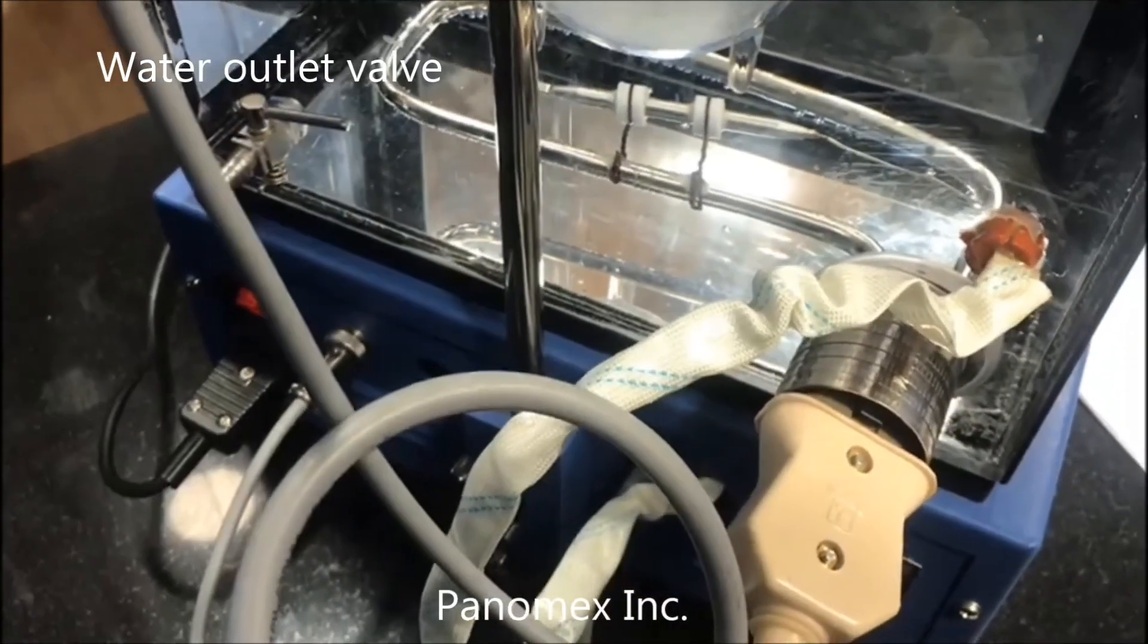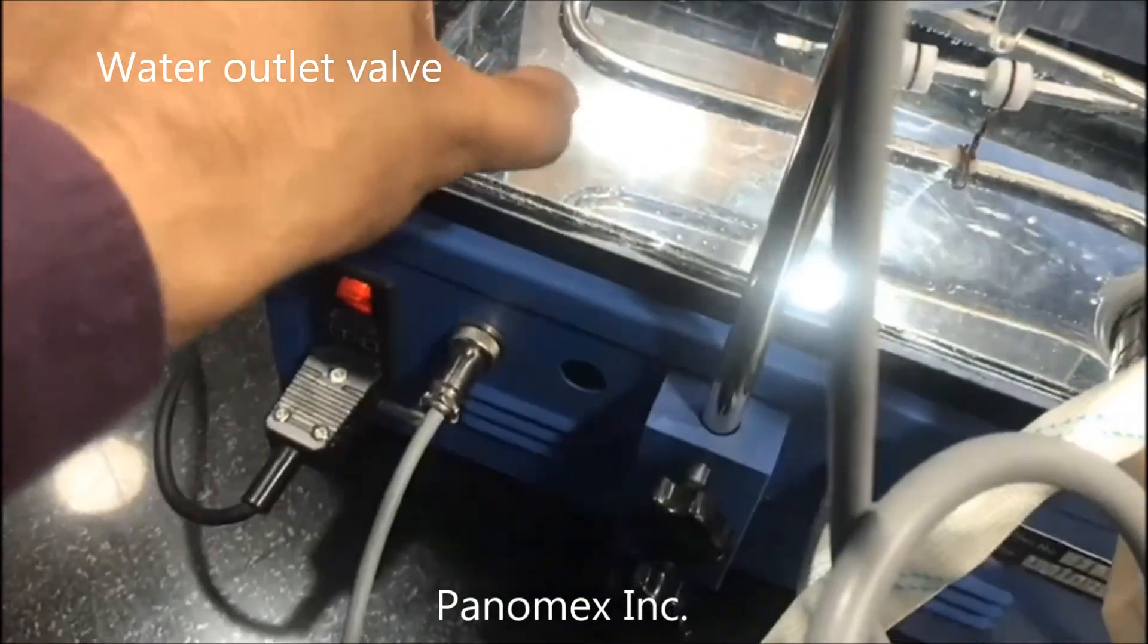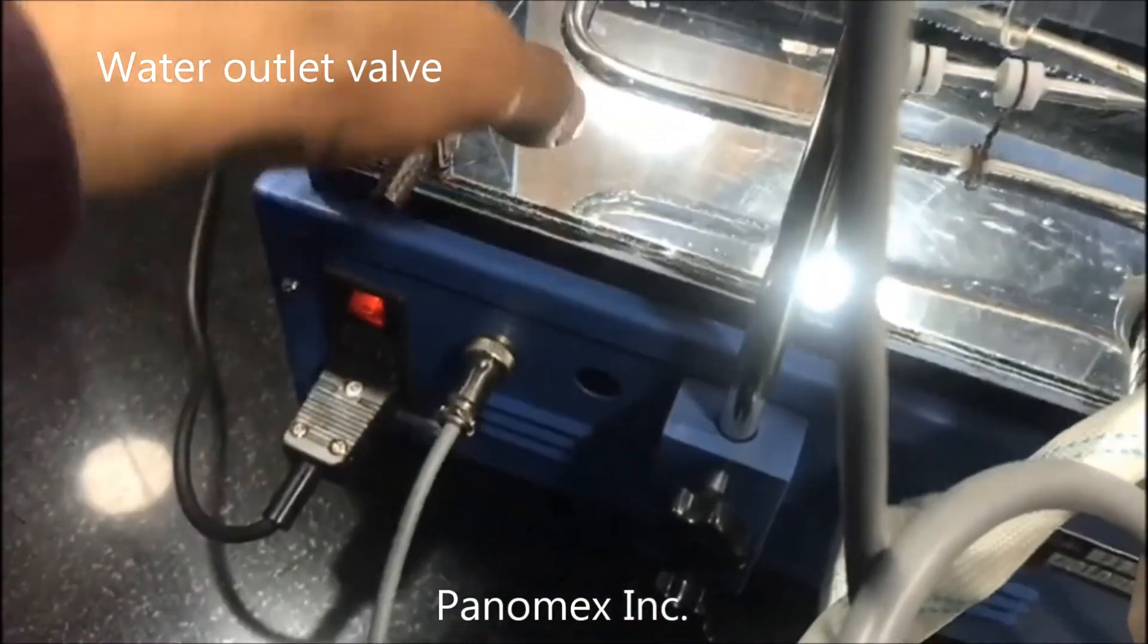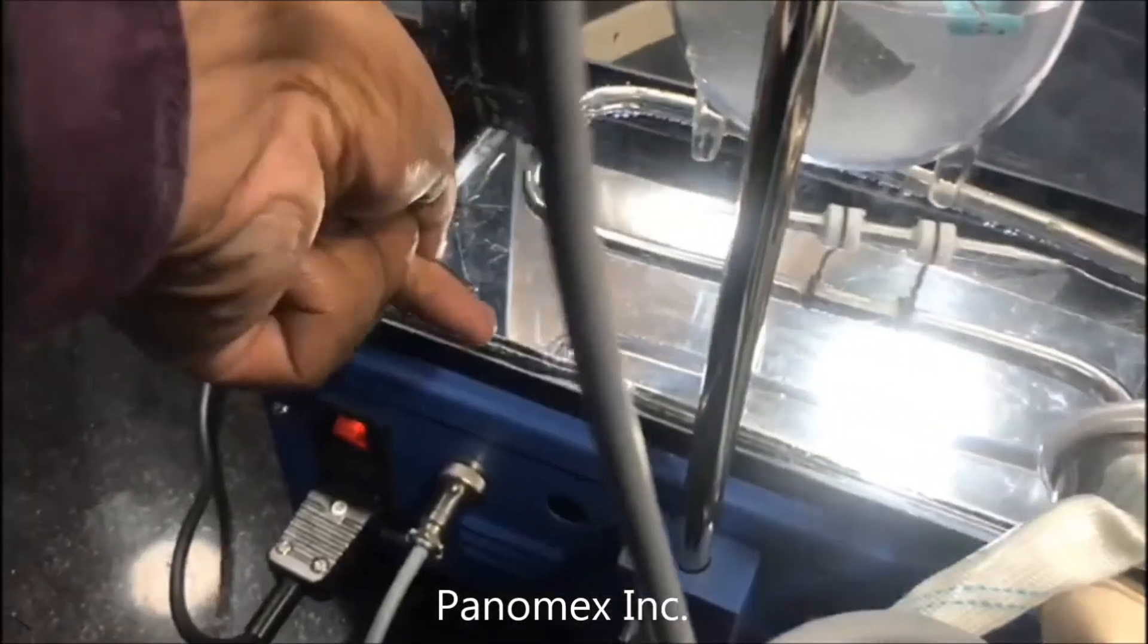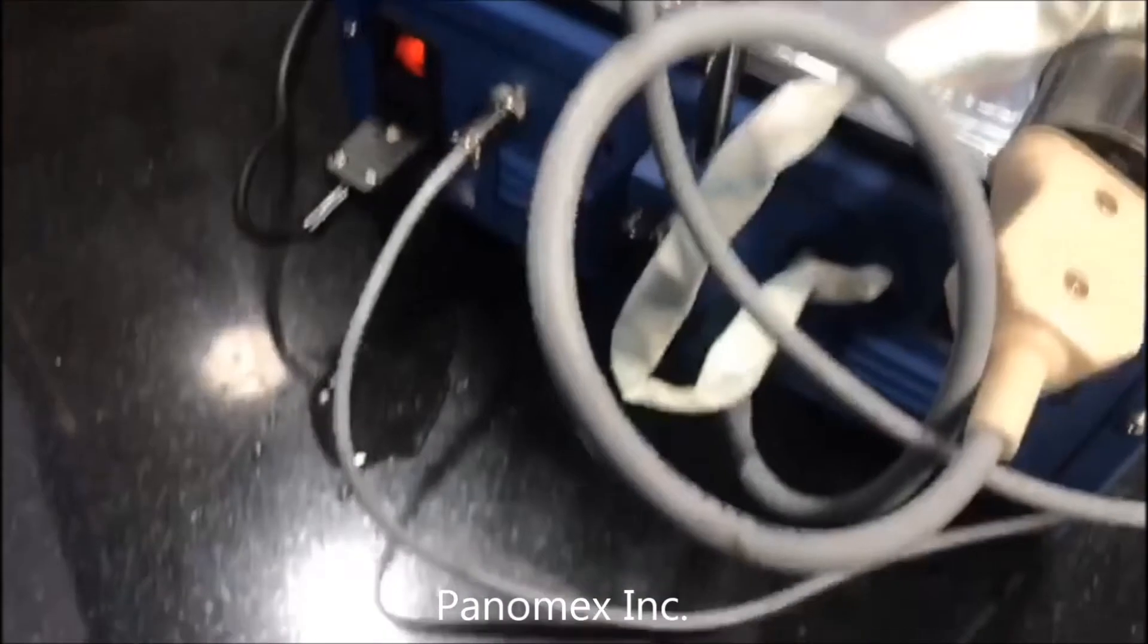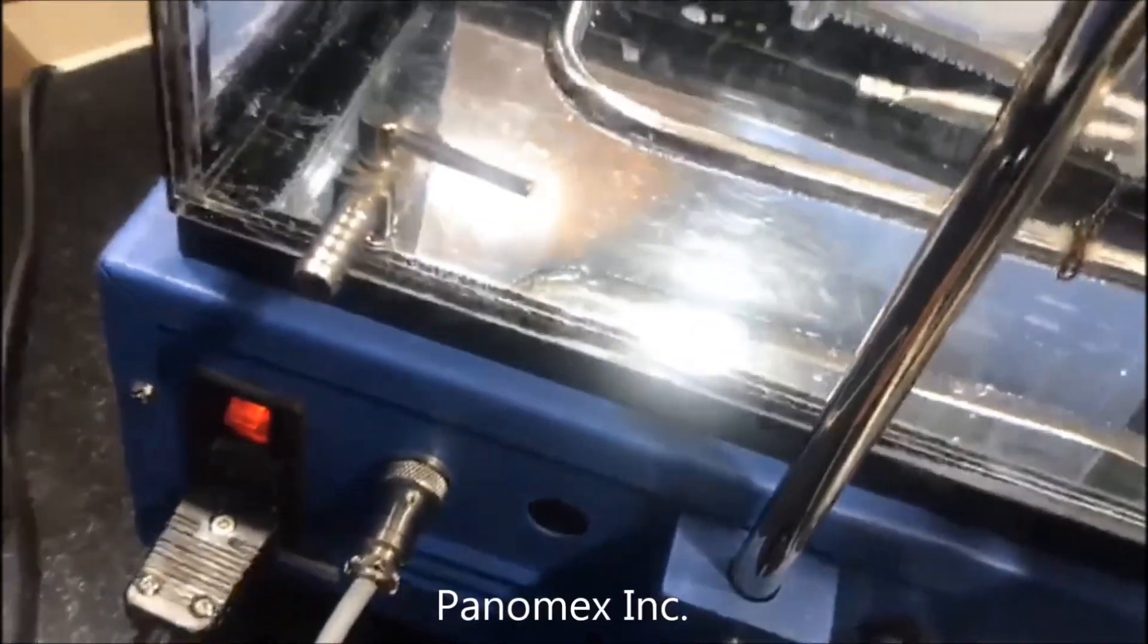This is the inlet and outlet which will help you to release water like this. As you can see, the water is out. Thank you.